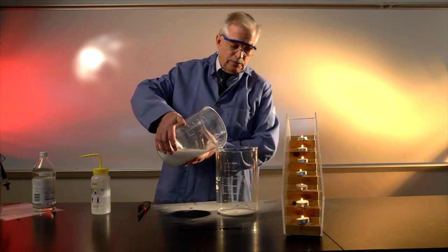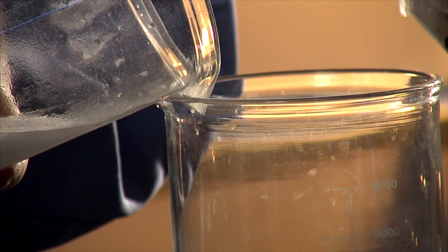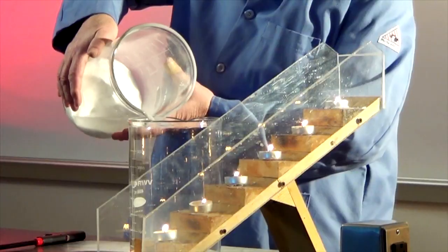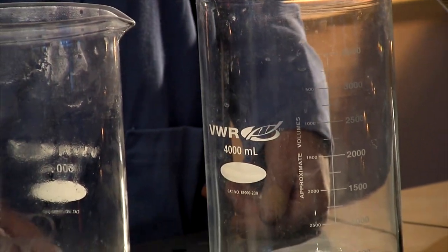And again, it's invisible, colorless, odorless, tasteless. So everybody probably thinks we're pretty crazy right now because you don't see anything going in there. Okay. Now this beaker is full of carbon dioxide gas.